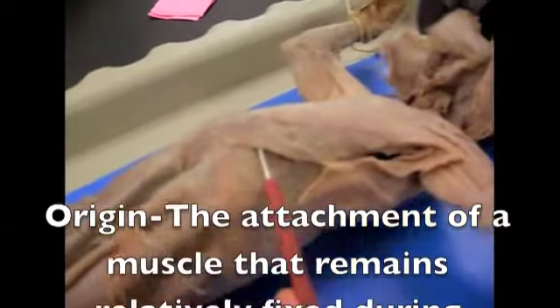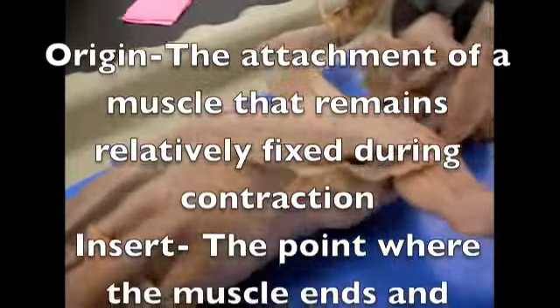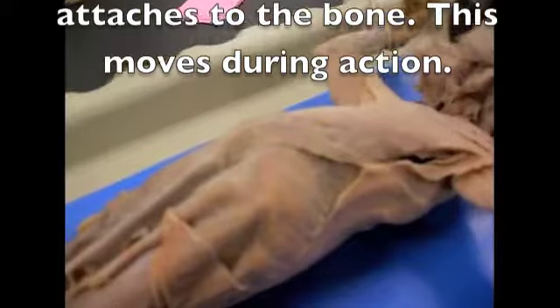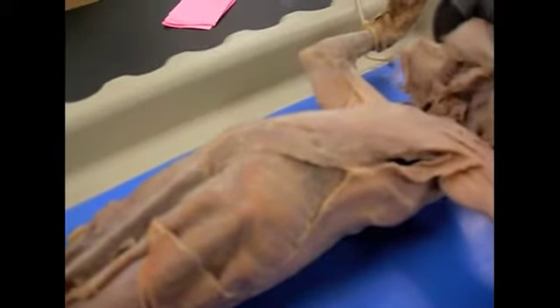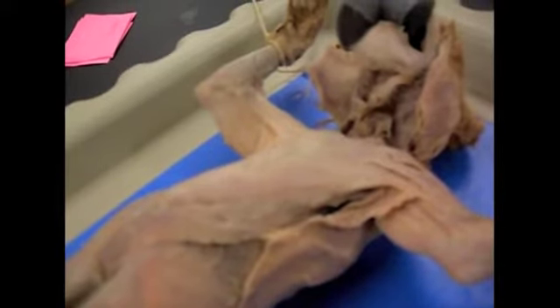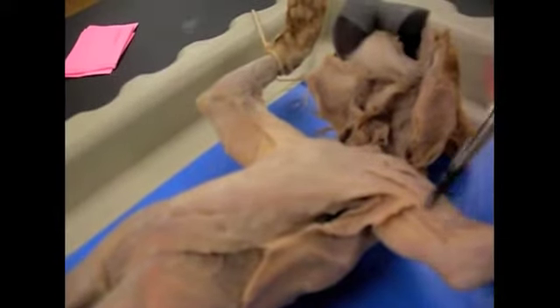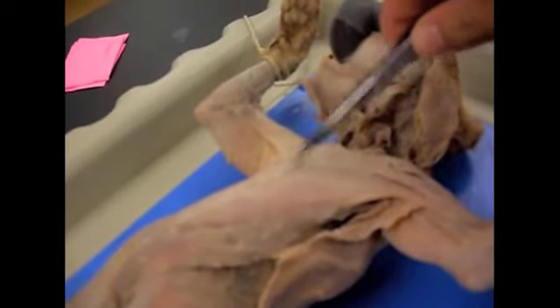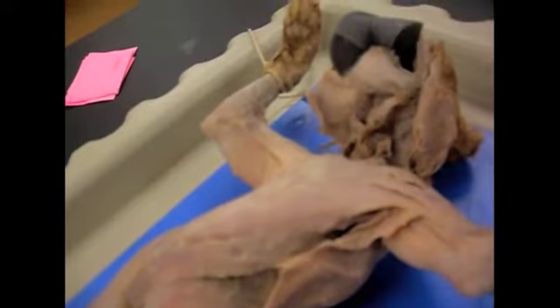This muscle right here is the xiphihumeralis. It originates in the xiphoid process, which is the most posterior part of the sternum, and inserts on the humerus. There is no muscle corresponding to this in man. This is the pectoralis minor. It is the bigger of the two pec muscles in cats, and it originates on the mid-posterior sternum and inserts on the humerus. This is your pectoralis major, the other pec muscle. This originates on the anterior part of the sternum, and it inserts on the humerus.